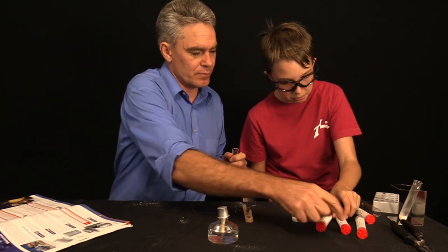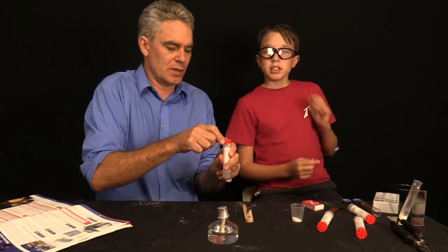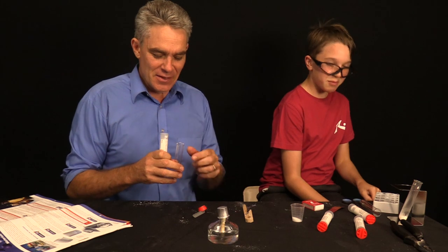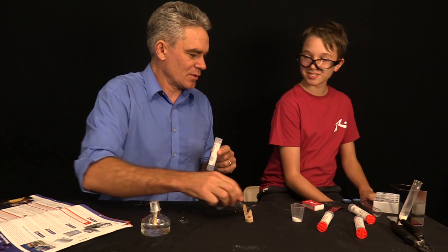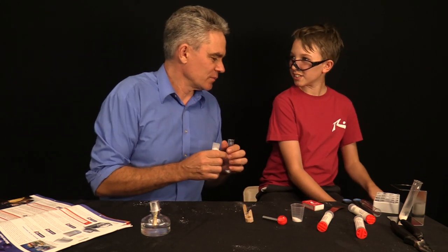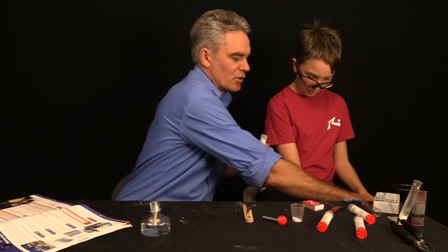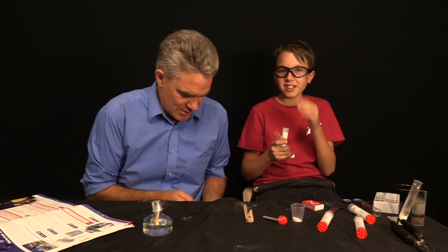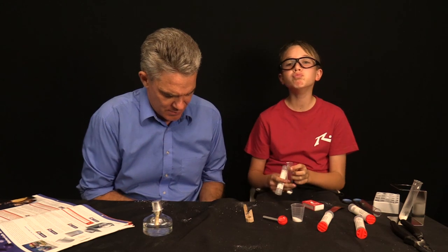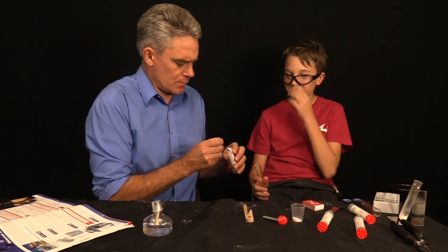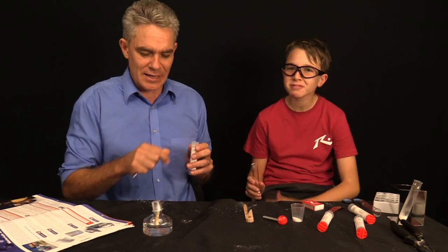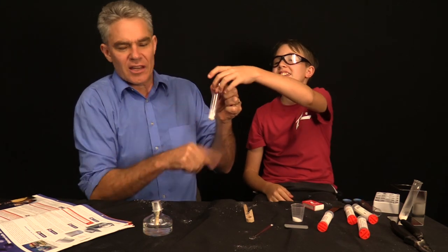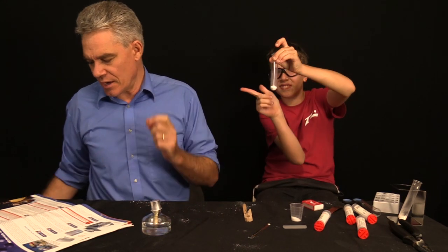And one spoon of ammonium chloride. There's ammonium chloride, NH4Cl. We don't want to use the dirty spoon, so wipe it on the tablecloth. Not like a moron. You'll want to try and use clean... The spoon is wet. The powder's not coming off. You hold those and I'll give it a good clean. That's a good clean, and I'll get the ammonium chloride. A big spoon. Hold it up and give it a good shake. The best way to shake a test tube is like this. Hold it between two fingers and go like this with your finger.